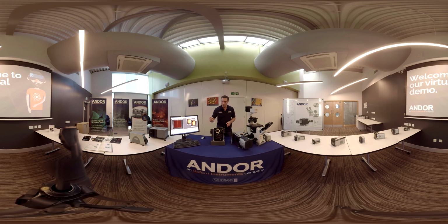In Czerny-Turners, you have a reflective grating as the dispersive element, and I'm going to remove it to show you a couple of features on the grating. So each turret can contain 2 gratings that are held almost back to back. There's a little room for adjustment during alignment, but they're so close to back to back that the center of rotation when you're selecting different wavelengths is almost on the front face of the grating, which again reduces aberrations and helps to create an excellent spatial and spectral resolution.